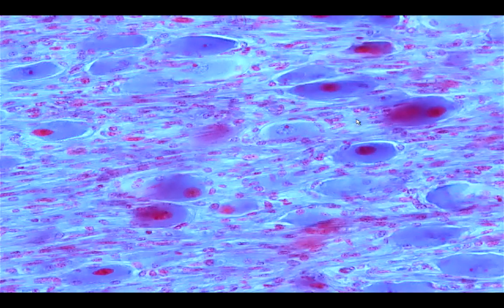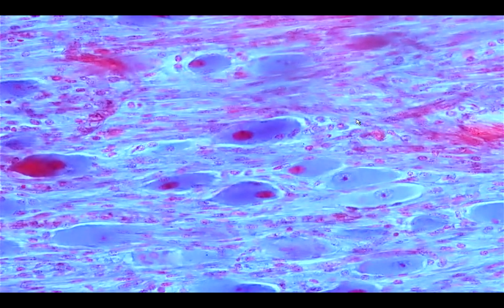Okay, so next we go to the ganglion. So the ganglion or the spinal ganglion will be located in the peripheral nerve there. Okay, and this time we can see the presence of large cells there. So these large cells, okay, they would possess a large nucleus, large cell body, prominence of the nucleolus. They are surrounded by nerve fibers and these round cells, which are called the satellite cells.